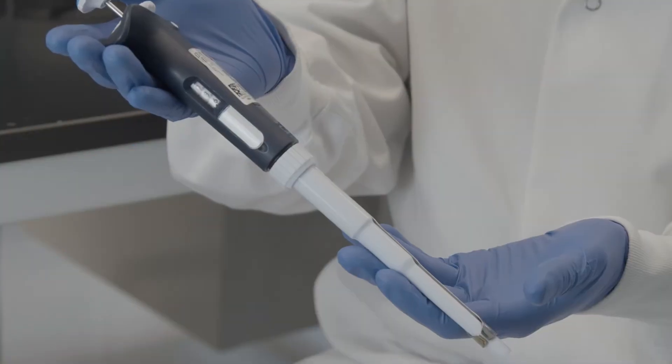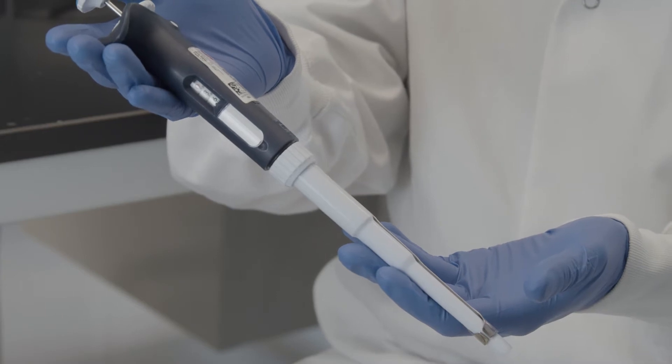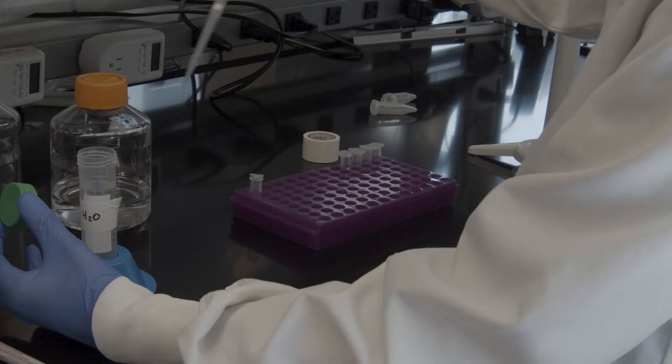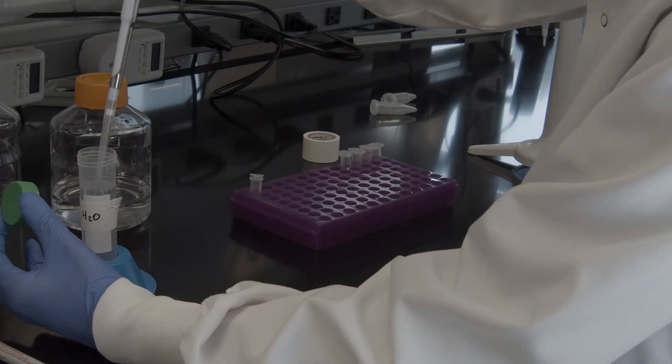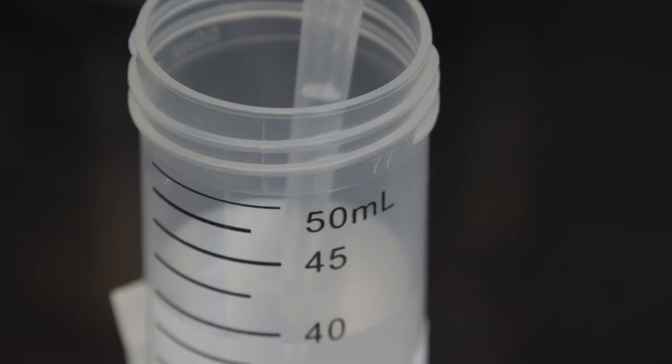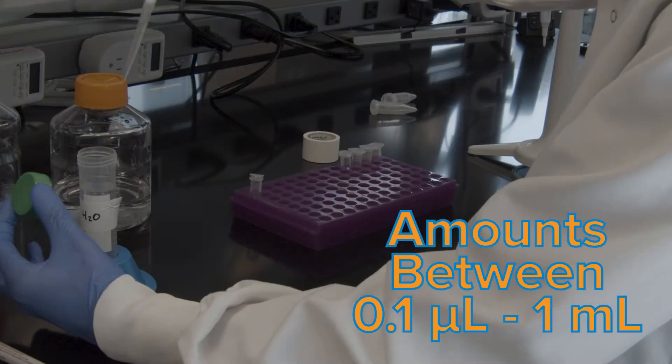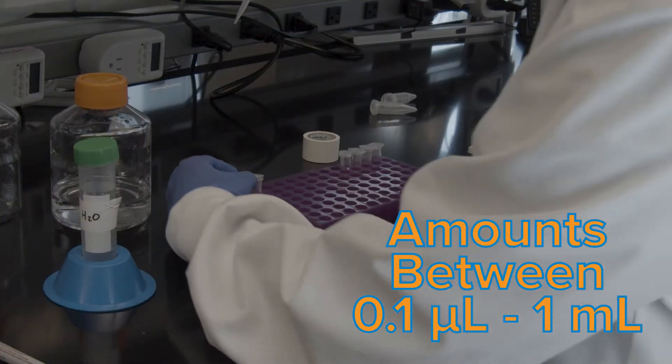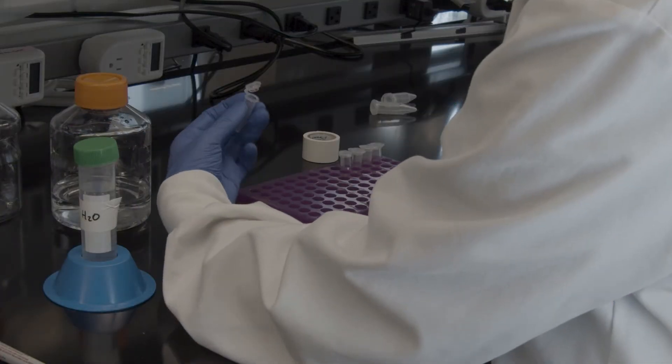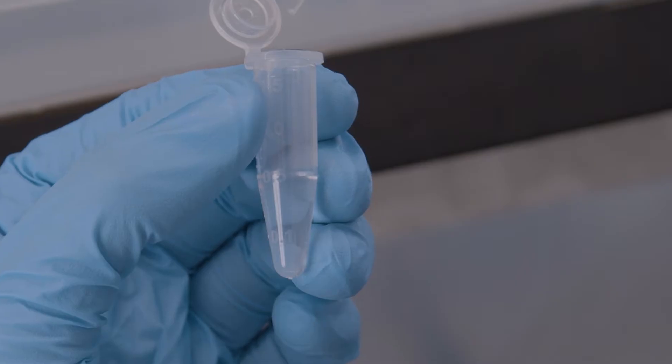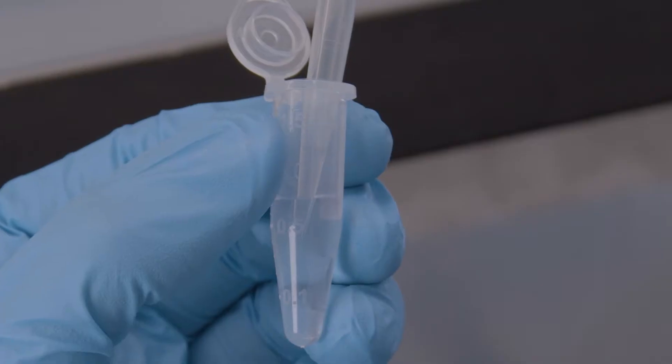This small object is an essential tool for nearly everyone in molecular biology. Using a pipette, you'll be able to accurately dispense small amounts of liquid, amounts between 0.1 microliters and 1 milliliter, far too small to eyeball accurately. Your lab work needs to be precise, and any changes, even very small ones, can negatively impact your experiment results.